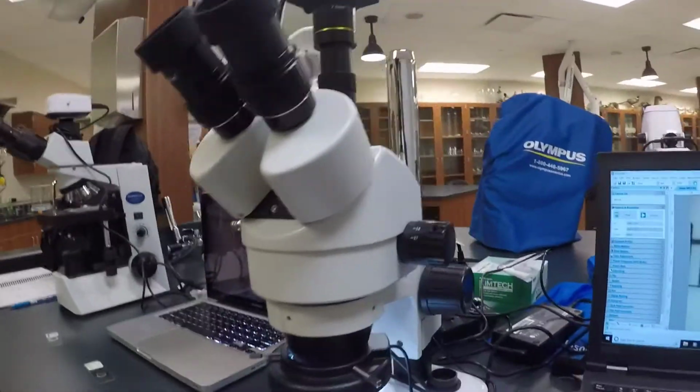So the dissecting microscope allows you to manipulate it at smaller increments, but clearly you don't have the magnification that you can get on that microscope. You can't go all the way up to 1,000 times your eyesight. Well, you wouldn't want it anyways, because you're not going to dissect the bacteria underneath the microscope.